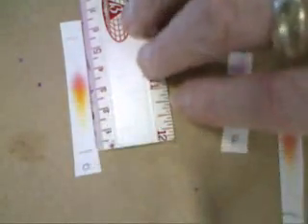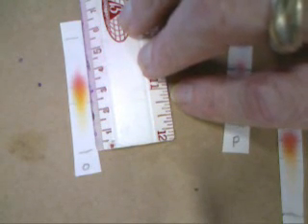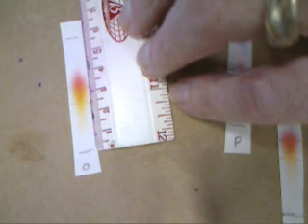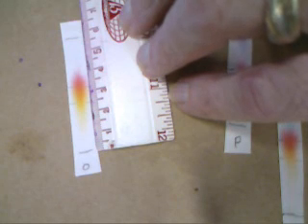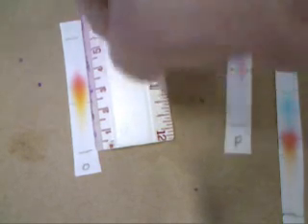And finally we move to our orange dye, and our orange dye seems to consist of only 2 colors. We have a yellow dot that seems to be centered about 2.5 and a red area that seems to be centered about 3.5. And so now we have measured all the values and motions of our different colored dots. We can now go on and calculate our RFs for the different colored dots.